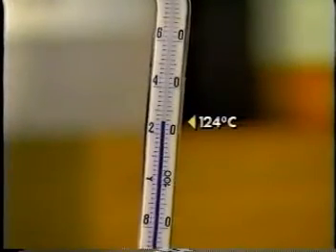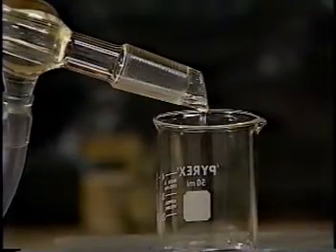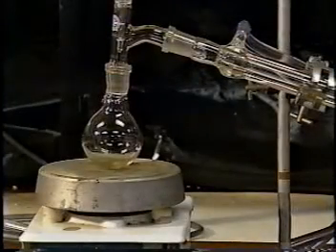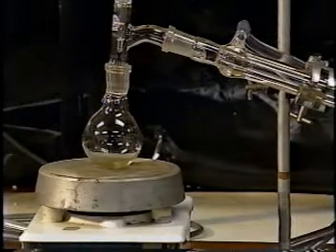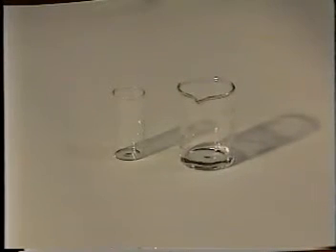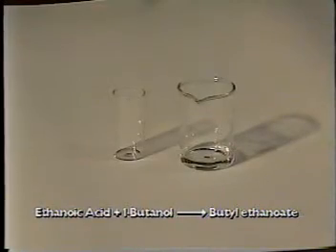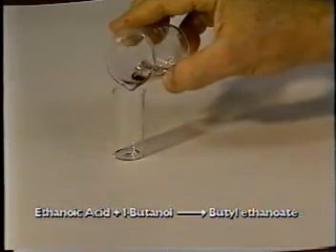Once the temperature reaches 124 degrees Celsius, we start collecting, because that is the boiling point of our pure butyl ethanoate. We continue to collect until most of the liquid in the flask has been distilled, stopping if the temperature rises above 124 degrees Celsius. The liquid before distillation had a slight yellow color, but now the distillate is quite colorless. We have completed our esterification and produced the ester butyl ethanoate from ethanoic acid and 1-butanol.